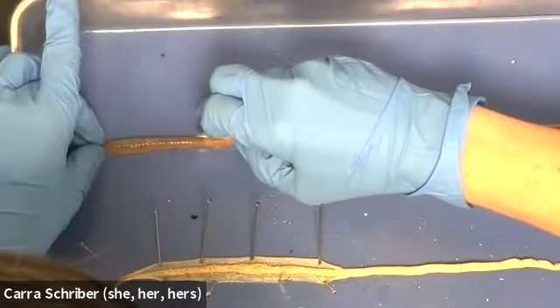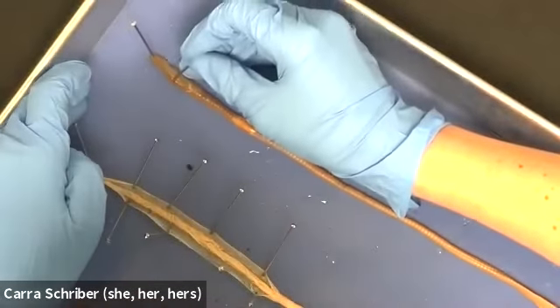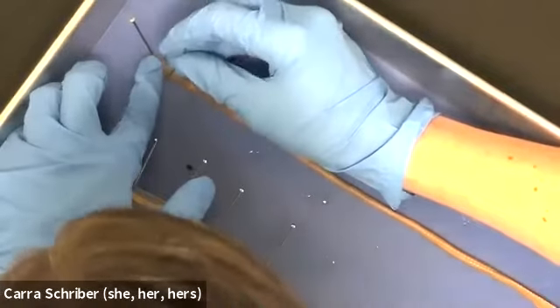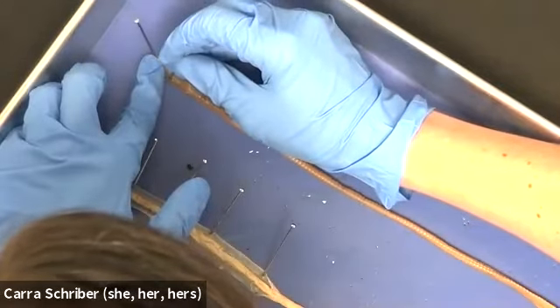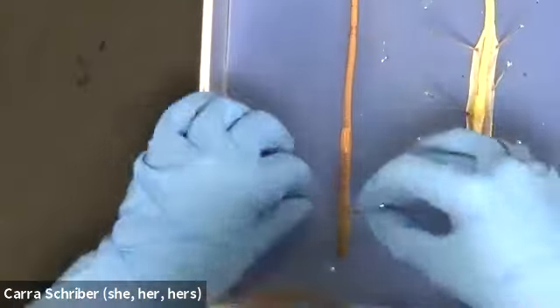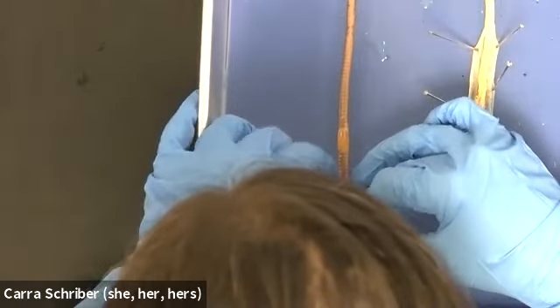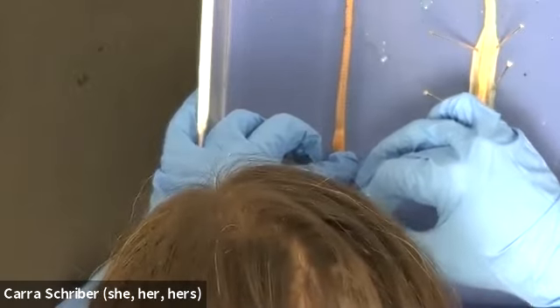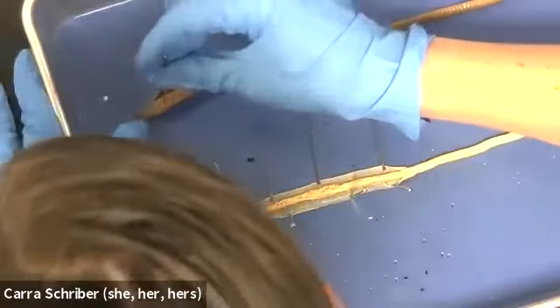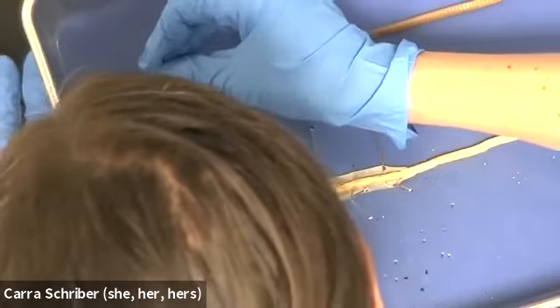All right, and I'm just going to cut to about right here. And then what you'll notice is I can't just open this flap up. There's some resistance, and that's because there's some connective tissue. So what I do is I take my pin here and I kind of drag it along the inside, right underneath the epidermis here, this ectoderm.